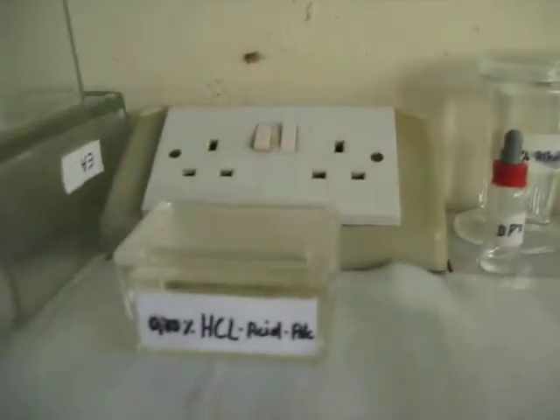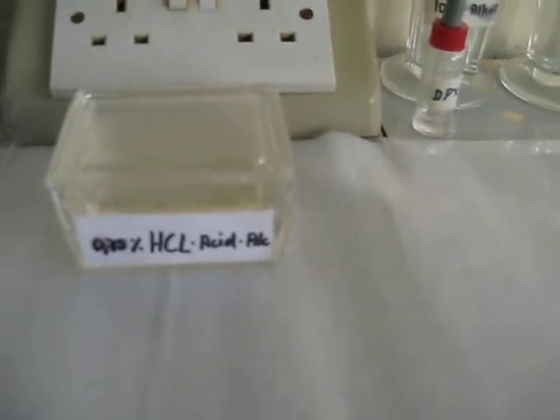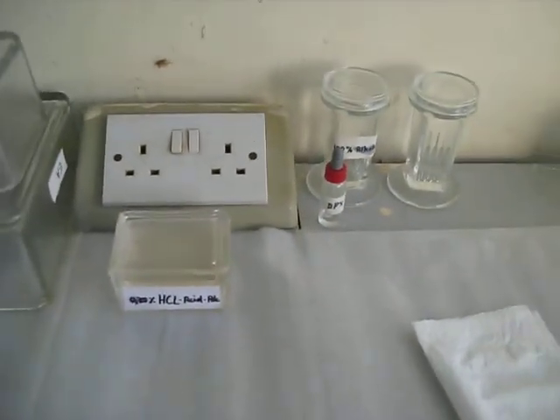There is a point where you have the SOP, which gives you clear guidelines as to what you should do in the lab. There are 12 steps plus the mounting stage, making 13 in total — meaning you need 12 containers and a stage for mounting. You also have HCl at 0.75%, which is very handy if you need to destain some slides or wash stains from containers stained with hematoxylin or eosin.